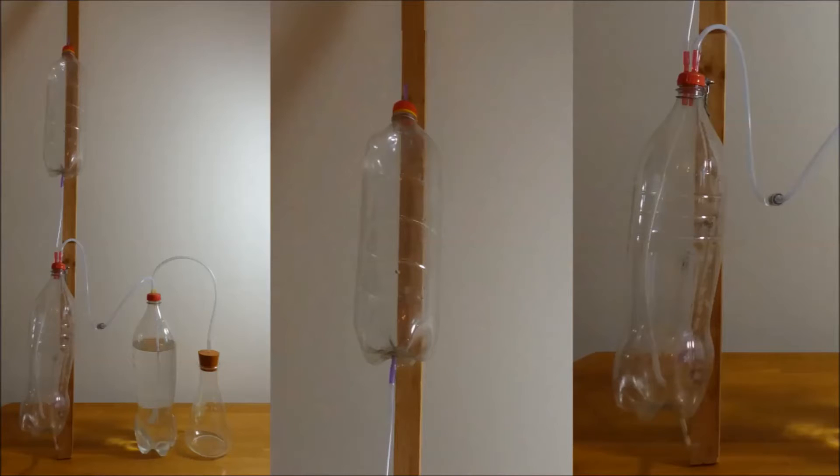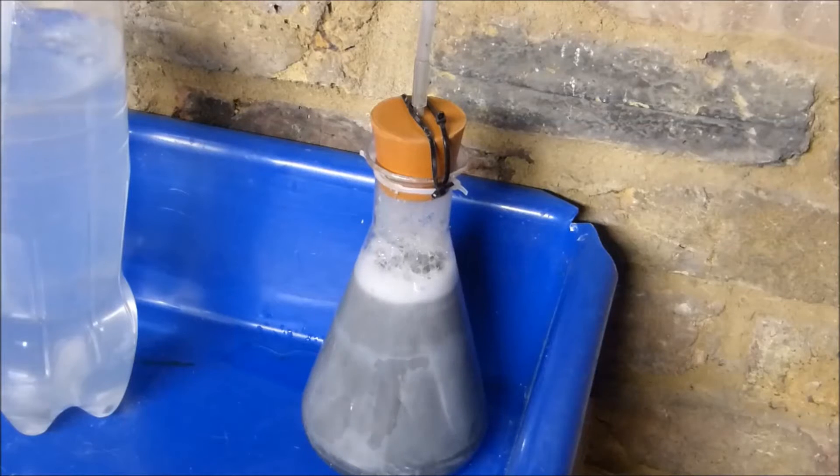Fill the bubbler with water until it's three quarters full and the bottom collection bottle until it is almost to the top. So that's the equipment ready.